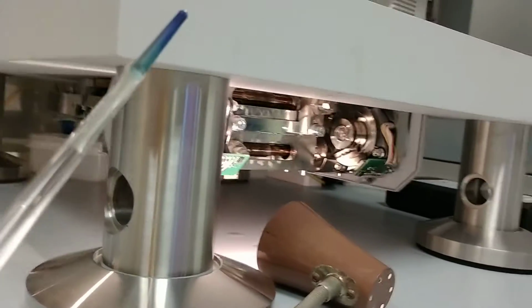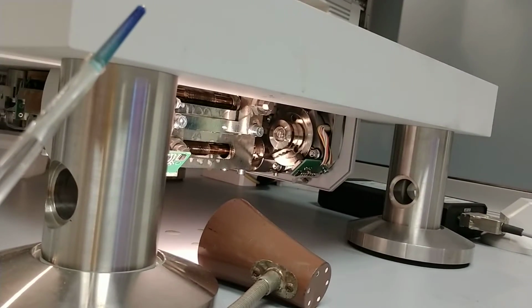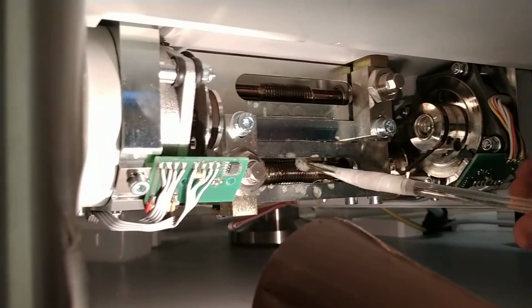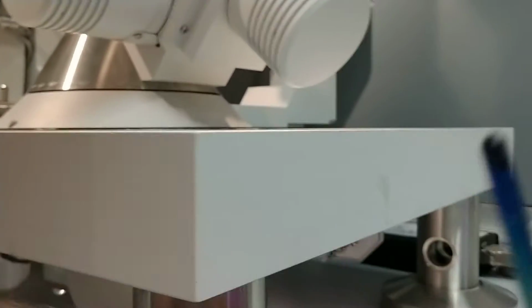Done in there, Steve? Yeah. Okay. Did you want me to lube it? At this point, do you want a lube? Yeah, go ahead. Go ahead and put a little on it now. Okay, I'm clear.